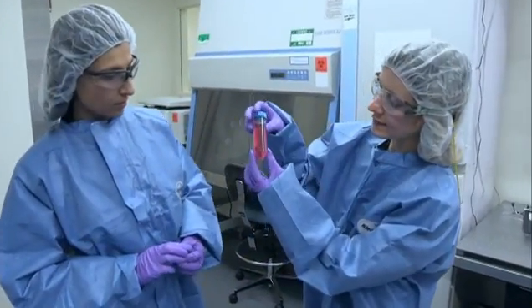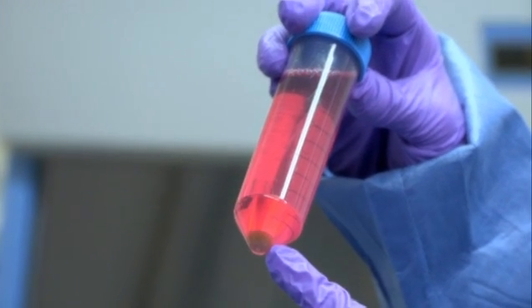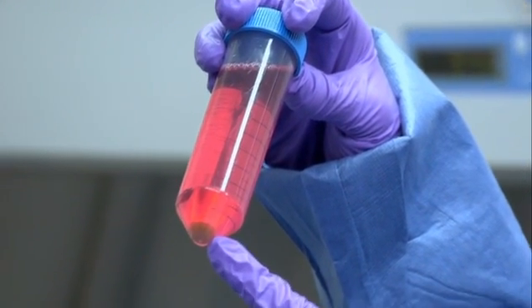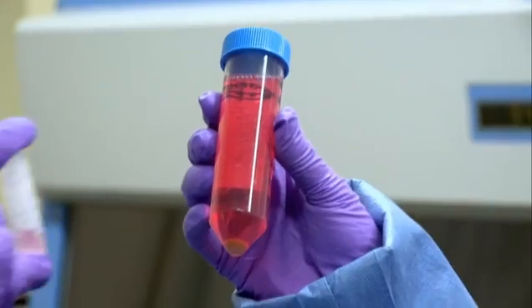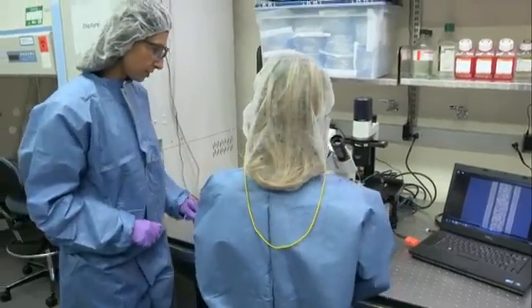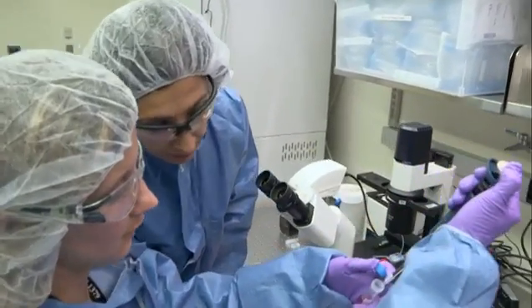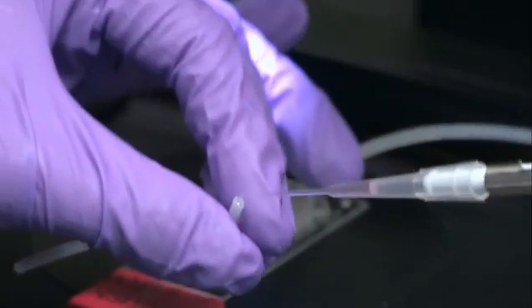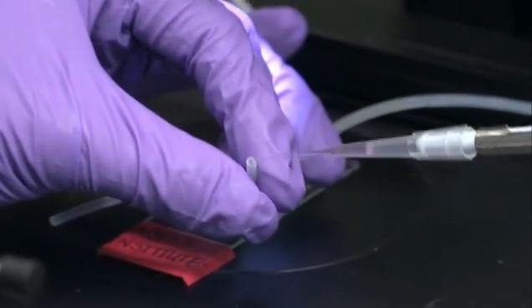And you can see here these have been processed and right there that pellet, that dark side, that's actually all the cells that we're going to put on the chip. So this is processed and becomes that? Exactly. And what we're going to do is we're going to take the cells, which are so small you can't actually see it, and we will load them into the chip.